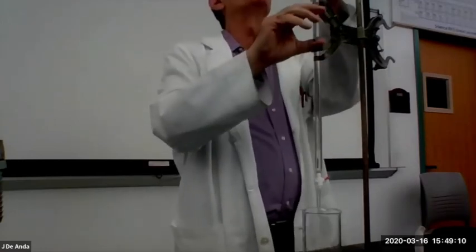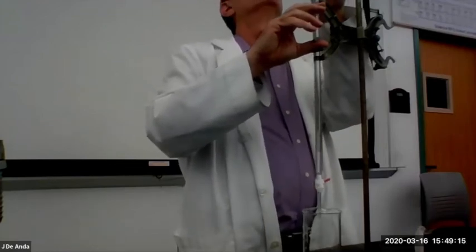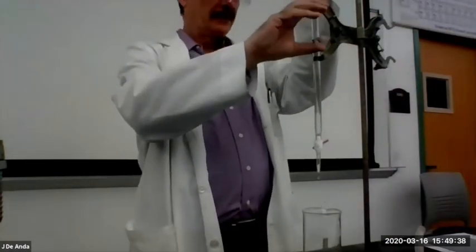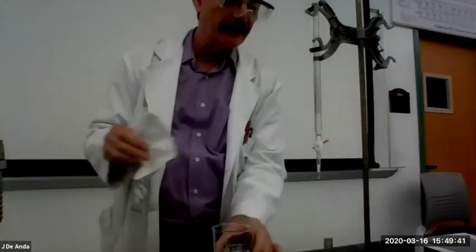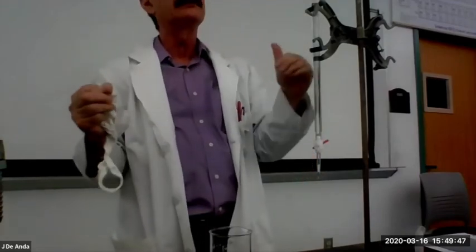So right now, my burette, when I read it, is actually at 0. Oh, you know what you can do if you're having a hard time seeing it, is put a piece of paper kind of behind it. And that way you can kind of better read what's in there. So right now I am at 0.20 milliliters, okay? 0.20. Okay, now I'm gonna bring it back up. I'm gonna take a clean piece of paper towel and kind of give it a little wipe on the outside, make sure that nothing's spilled, because the only liquid that I want in my reaction mixture is the one that's inside the burette.